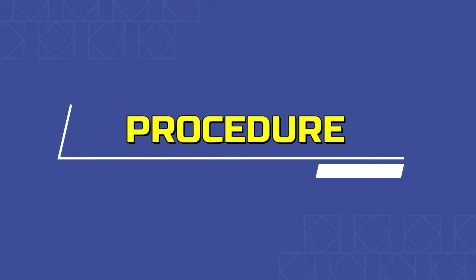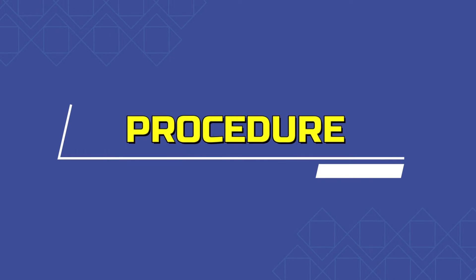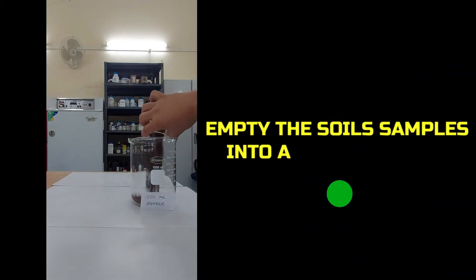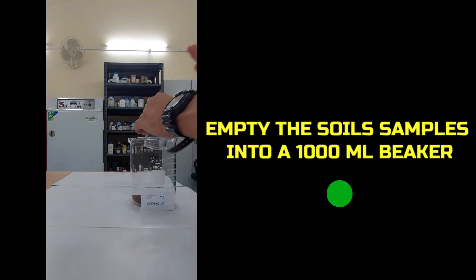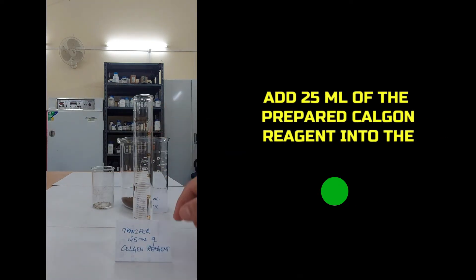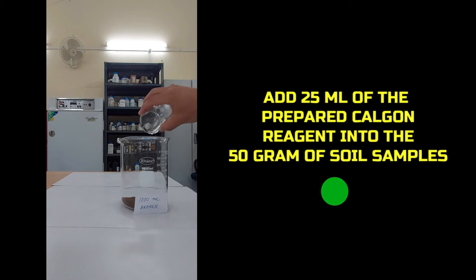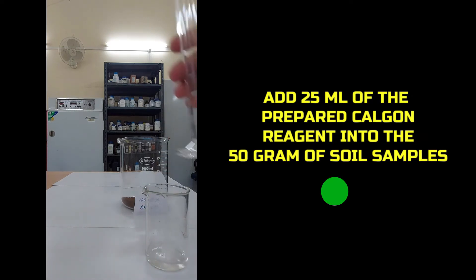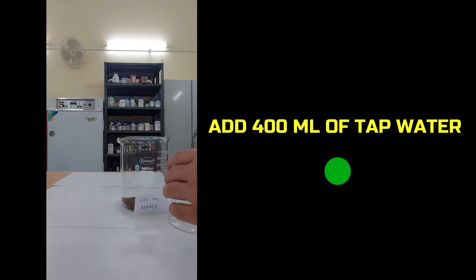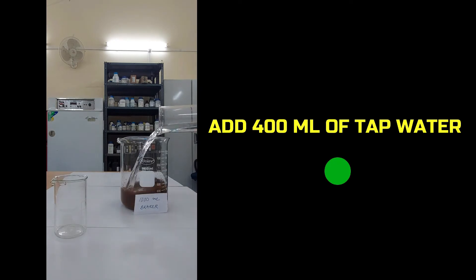Let's follow the procedures for estimation of soil texture using the hydrometer method. The first step is to empty the 50-gram soil sample into a 1000 ml beaker. Then add 25 ml of prepared Calgon reagent into the 50-gram soil sample in the 1000 ml beaker. Then add 400 ml of tap water into the beaker containing the soil and the Calgon reagent.